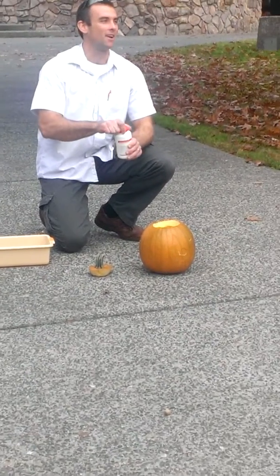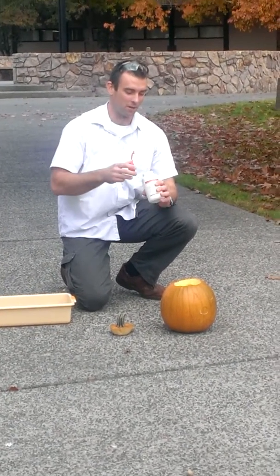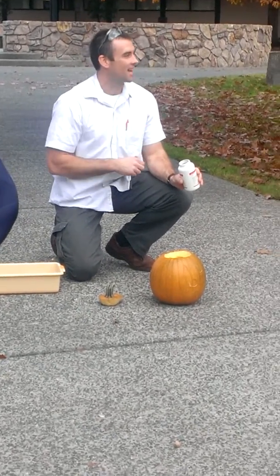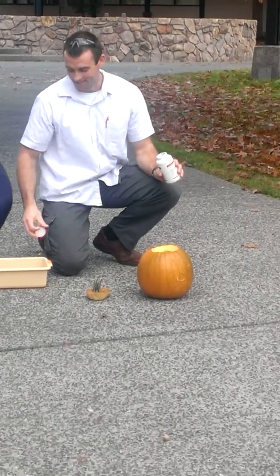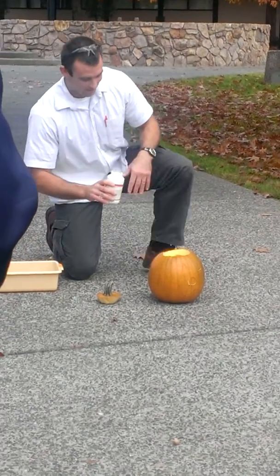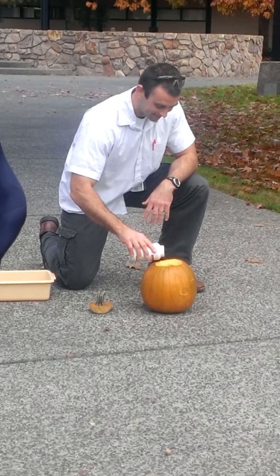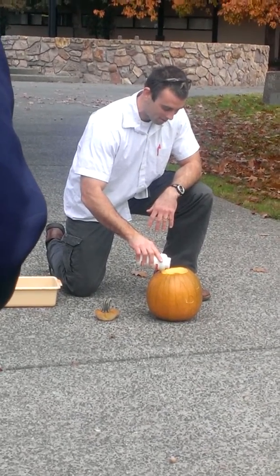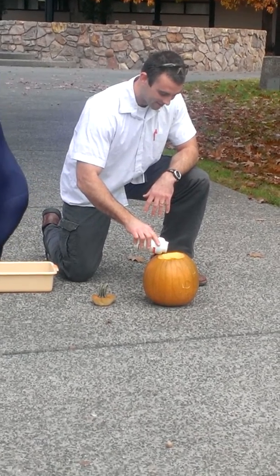The lamps that miners used to use had a little bit of this calcium carbide and a little bit of water, and then they'd light it and it would burn for a long, long time. So we're gonna add a couple of these pellets. Unfortunately, I didn't bring my gloves. And we're gonna light it once it fills with a nice amount of acetylene.